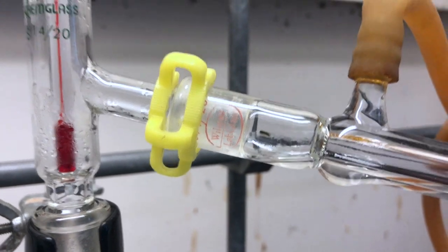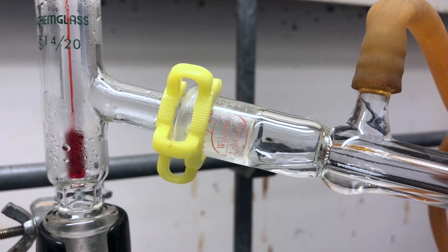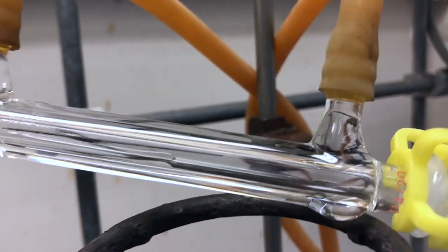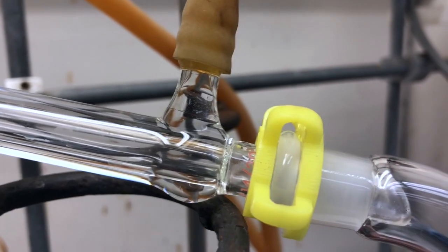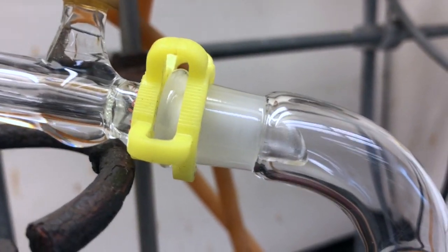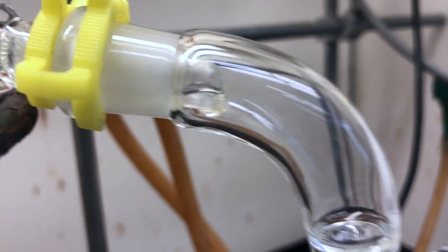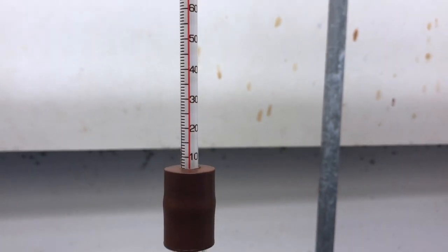There's our first drops of distillate right there. And there's our first drop. It looks as though the first drop came into our graduated cylinder just below 85 degrees Celsius.